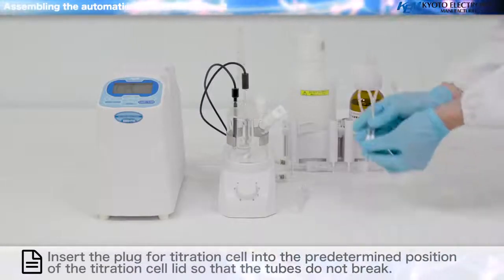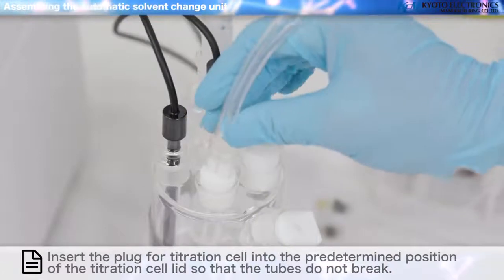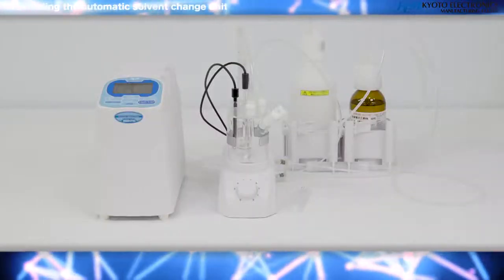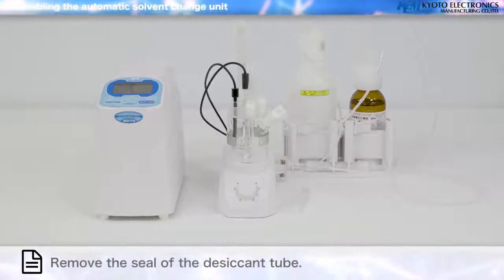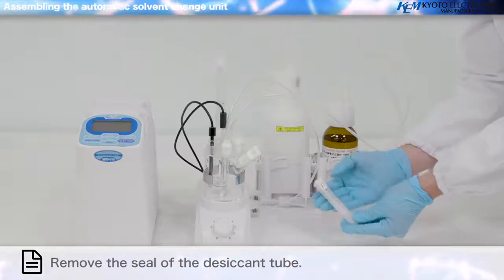Insert the plug for the titration cell into the predetermined position of the titration cell lid so that the tubes do not break. Port plug and the syringe inlet. Remove the seal of the desiccant tube.